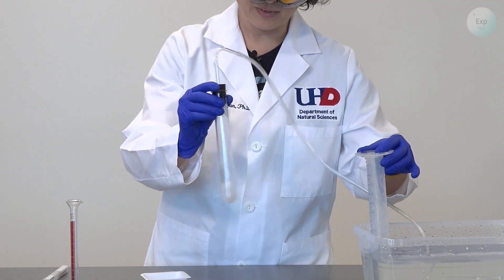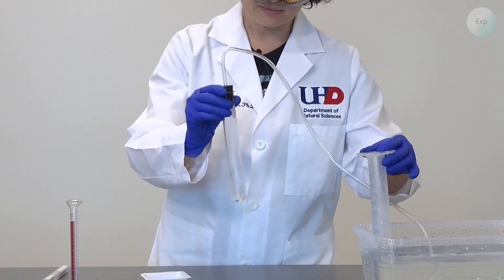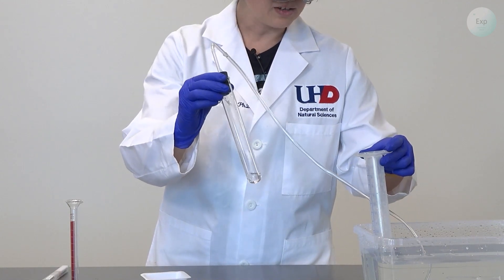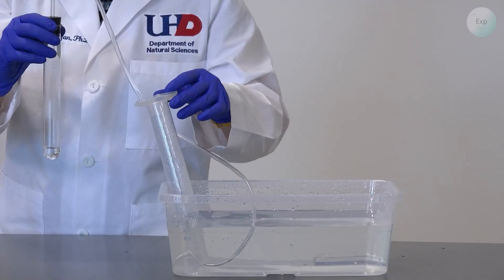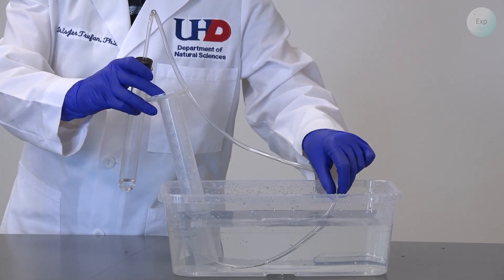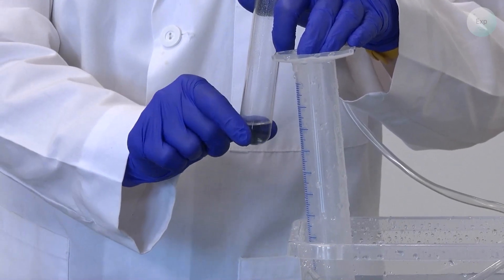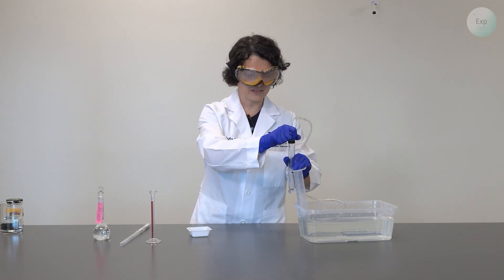I have a little bit more magnesium in my test tube, so I will wait a little longer. The resulting solution should be colorless because magnesium chloride is a white powder which produces a colorless solution. The magnesium ribbons are gone and the bubbling has stopped, indicating that our reaction is complete. Now I can remove my rubber tubing from under the graduated cylinder. Just to check whether the reaction is exothermic or endothermic, we can gently touch the bottom of the test tube — it's quite hot, so this was a rather exothermic process.